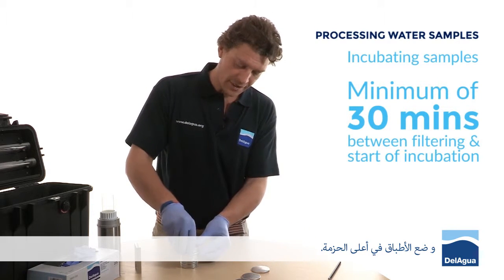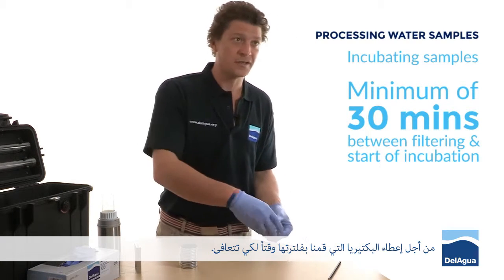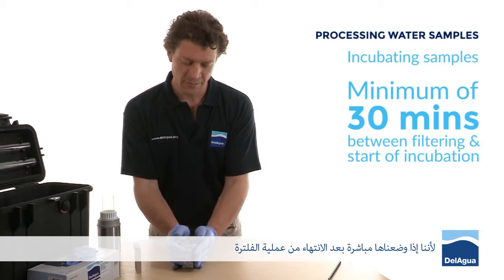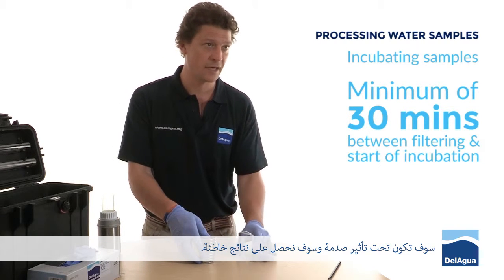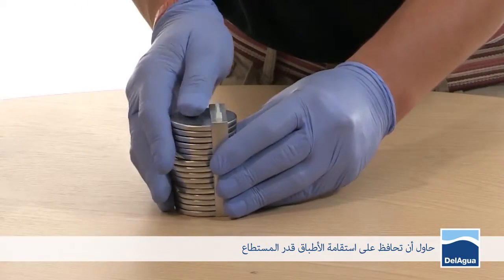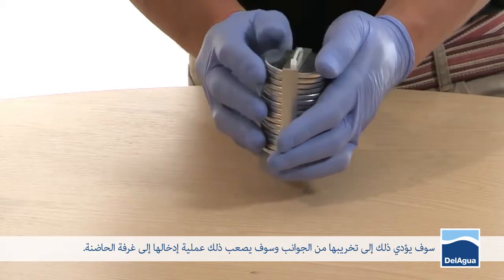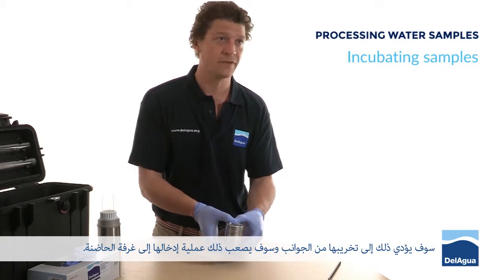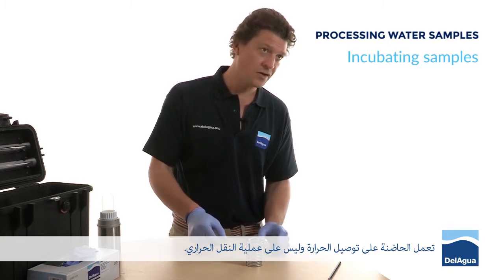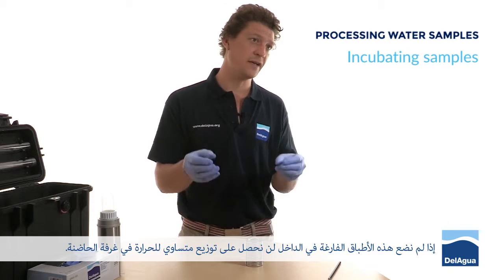The half-hour wait is in order to allow the bacteria, which have just gone through the process of being filtered, time to recover. If they went straight into the incubator, there's a possibility that the shock might do them no good and you could end up with a false report. Try to keep the stack of petri dishes as upright as you can and gently slide them into the strap — don't force them, as you'll catch edges and tear them. I notice you've got empty petri dishes in there as well — why is that? Because the incubator unit works on conduction of heat rather than convection, so without the empty petri dishes you wouldn't get an even distribution of heat through the incubation chamber.